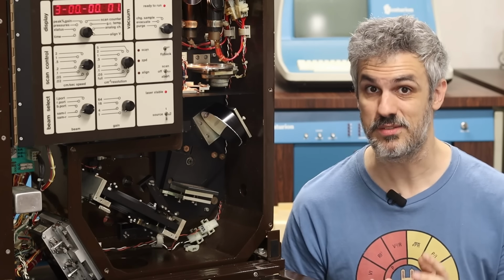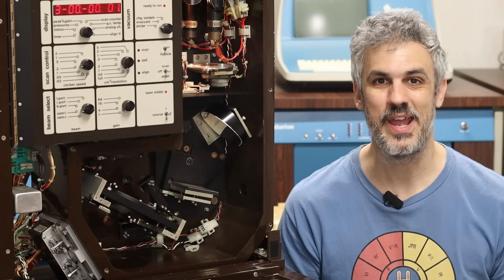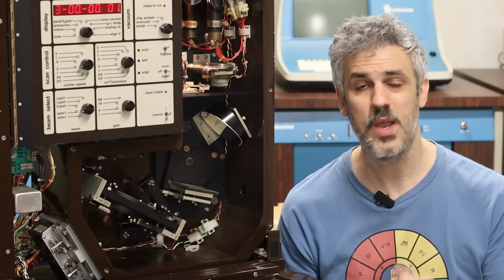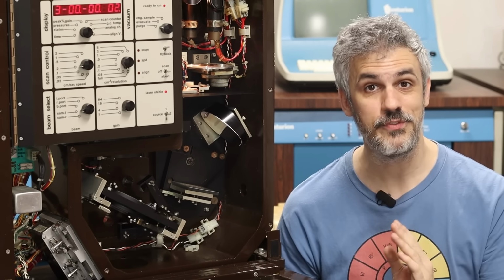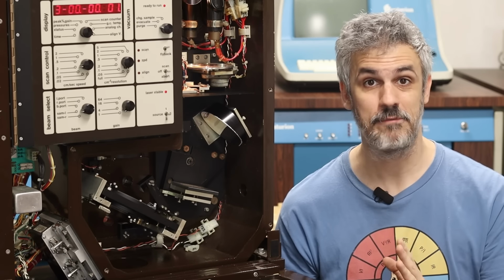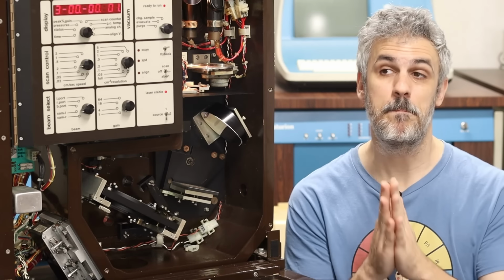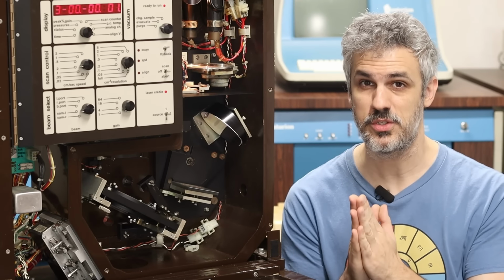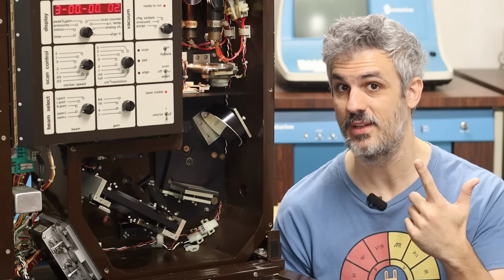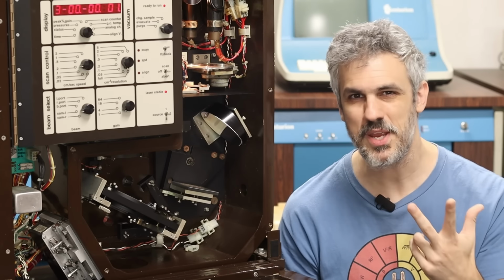The laser is currently on. You can see it says laser stable right here. And I'm not sitting here wearing special laser safety glasses. And you guys are absolutely right. Laser safety is something that has to be considered. You only have 2 eyes, and lasers can absolutely melt them. But also, I think it's very important to understand the type of laser that it is, the power of that laser, and the environment in which that laser is being used. So let's break each one of these down.